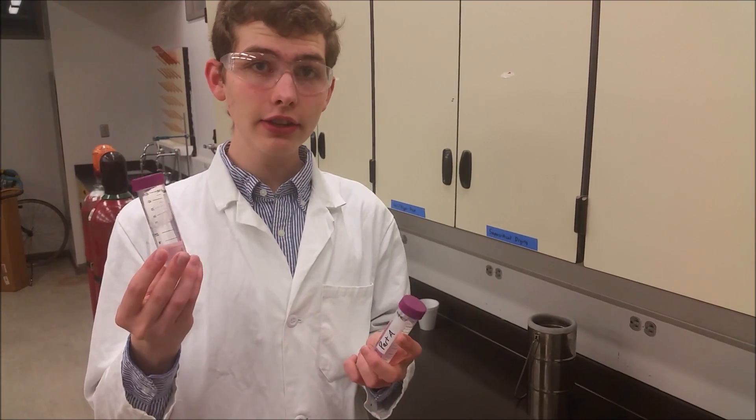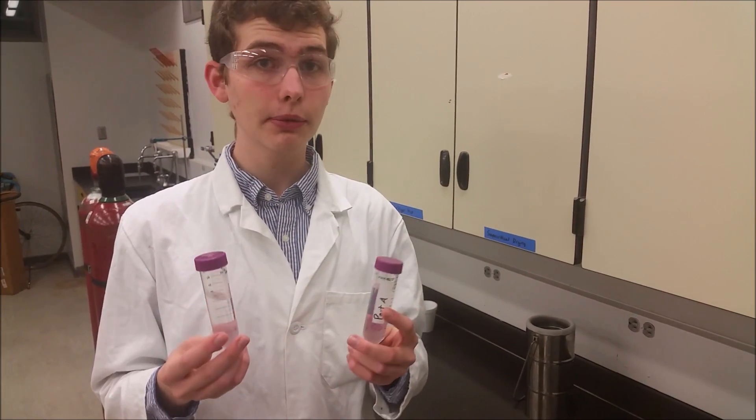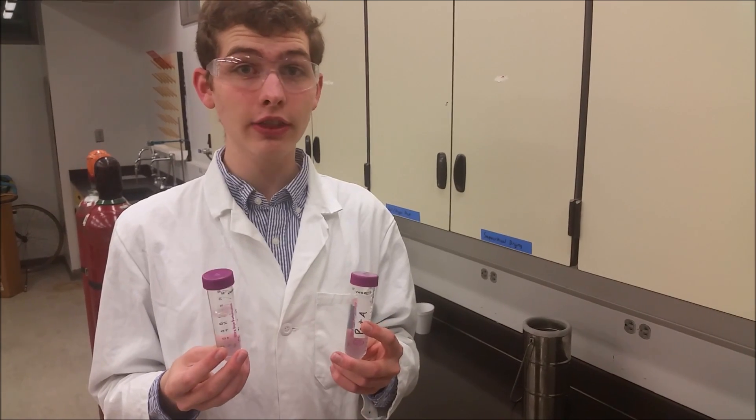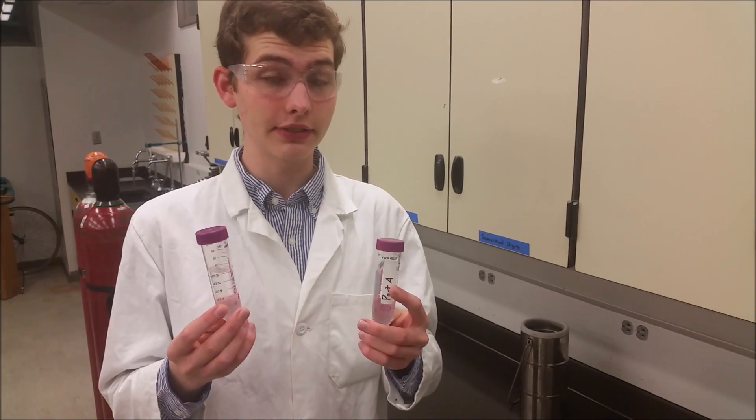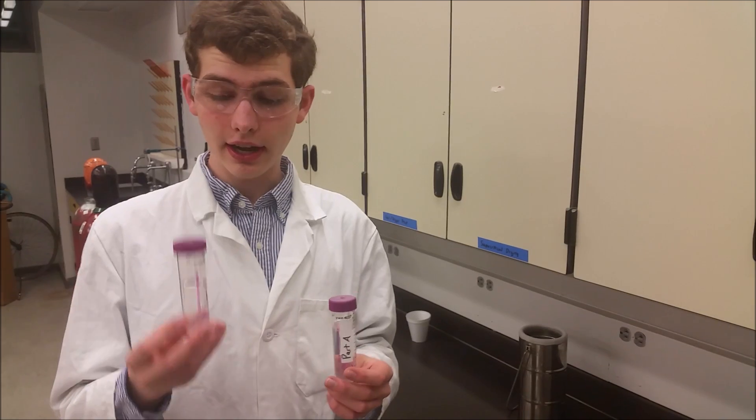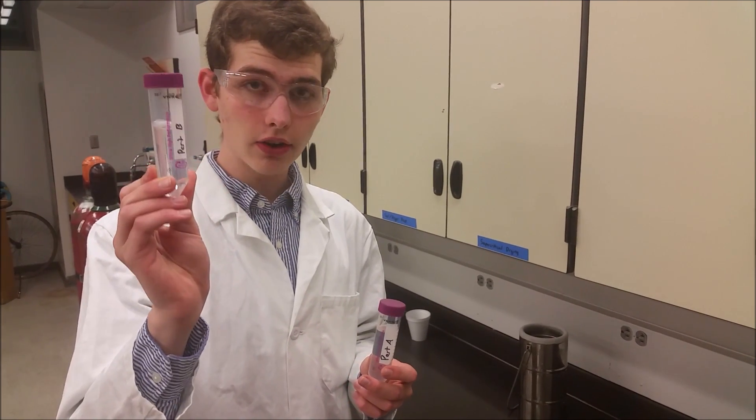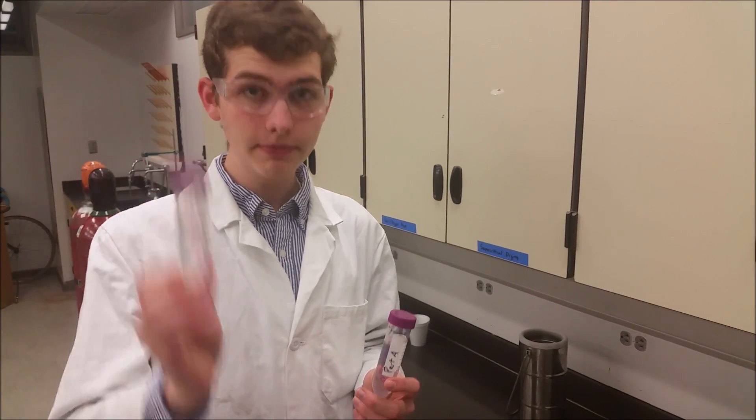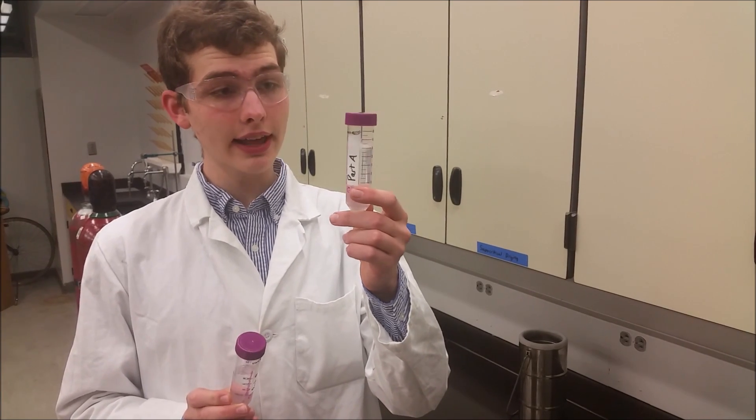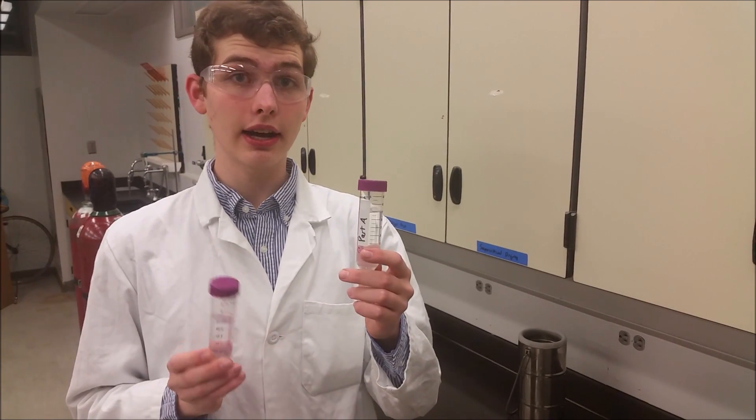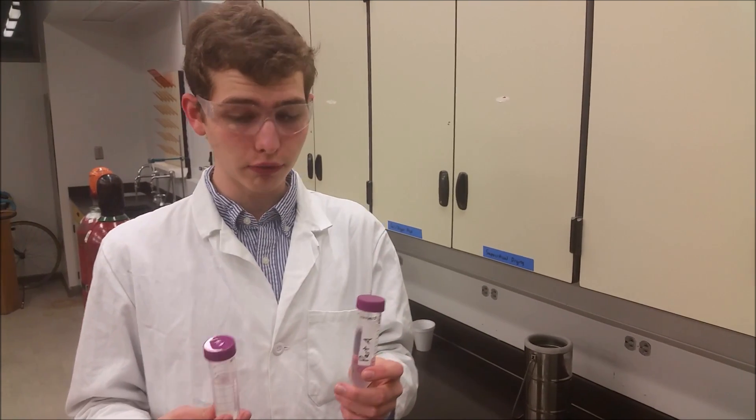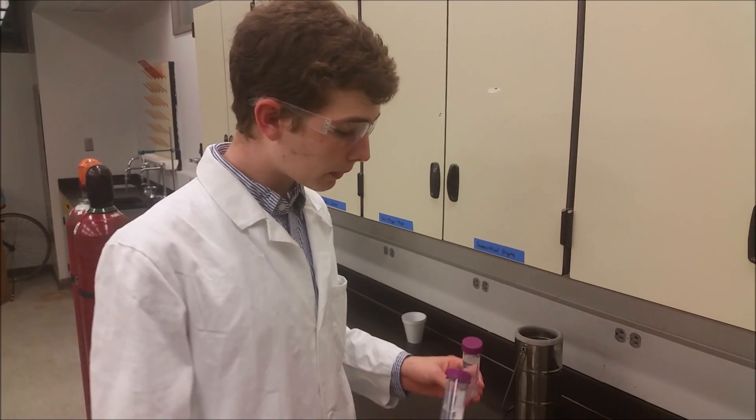There's ethanol and a chemical called tetraethyl orthosilicate in these vials. And this one contains ethanol and tetraethyl orthosilicate, and this one contains ethanol and catalyst along with a very small amount of water.